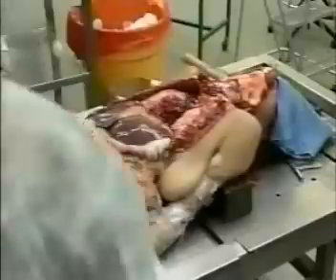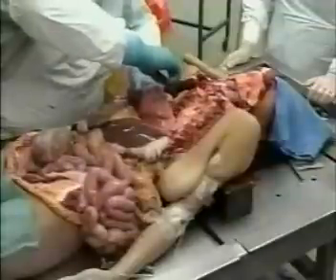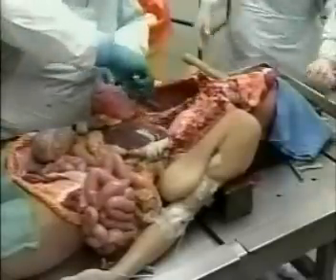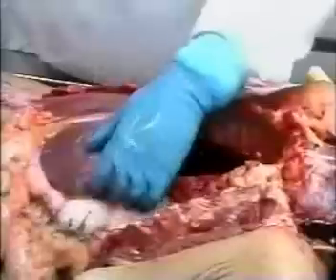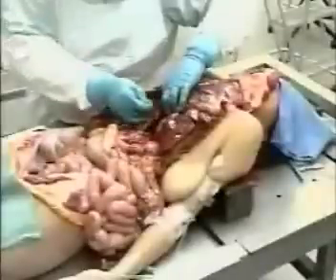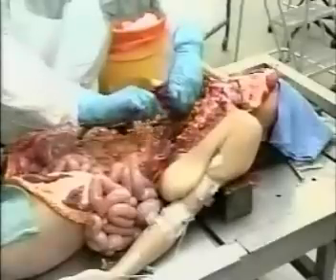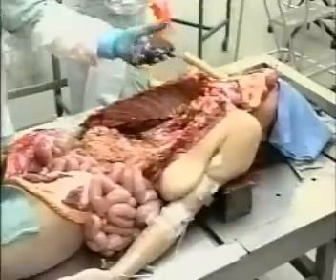Now the heart has been removed. The next step will be to remove the lungs — he's taking the right lung out first. He's cut the bronchus, the main airway to the lung, and noticed that there was some mucoid material in that bronchus. He's now removing the pericardial sac and reflecting the diaphragm in order to free up the liver for removal. The spleen is coming out now; it sits in the left upper quadrant of the abdomen and is about a normal shape and size.